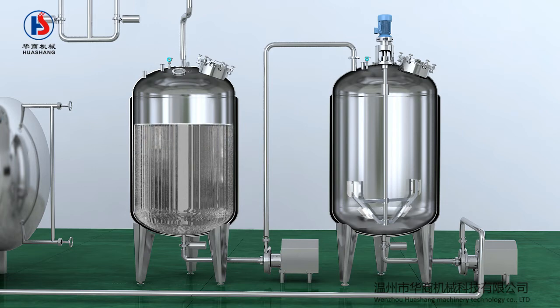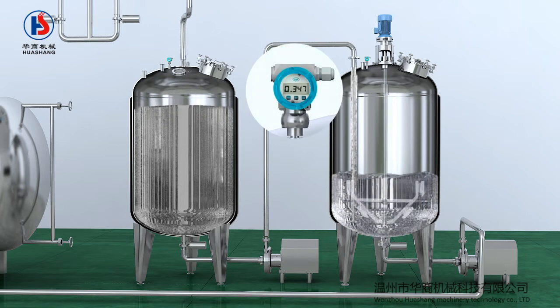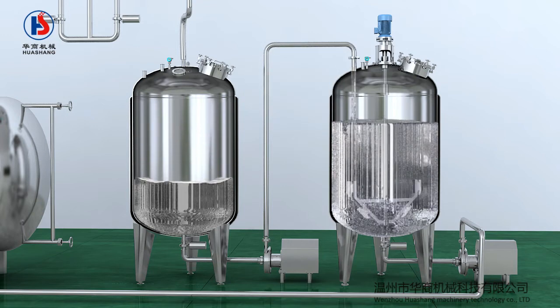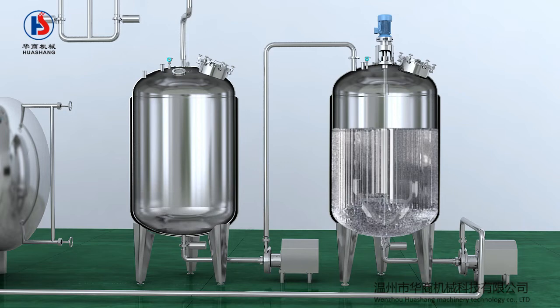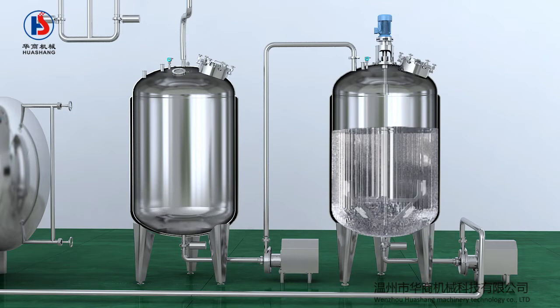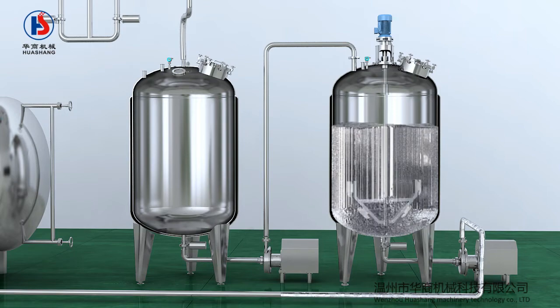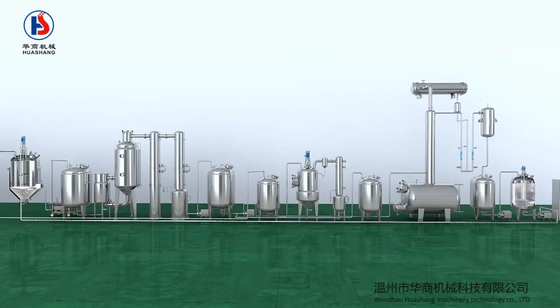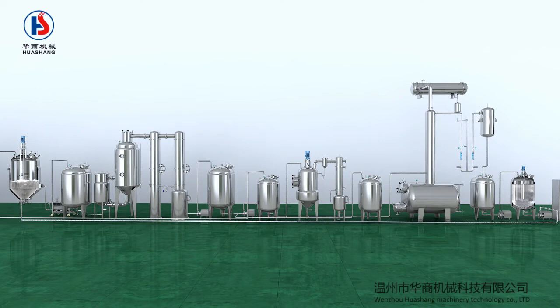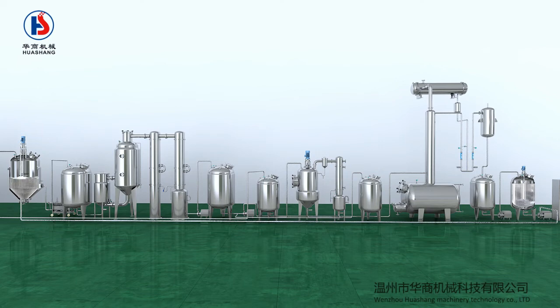The alcohol then returns to the alcohol storage tank. When the liquid level reaches the required level, the automatic level sensor sends a signal to the pump, and the pump opens automatically. The alcohol can be transferred from the alcohol storage tank to the preparation tank, to prepare diluted alcohol according to the alcohol concentration and liquid ratio. After mixing into the required concentration of alcohol, open the bottom valve and transport the prepared alcohol to the alcohol sedimentation tank for the next cycle of the alcohol precipitation process.